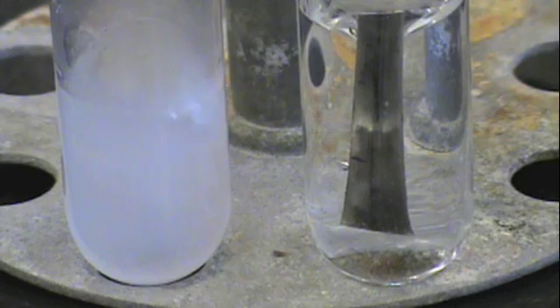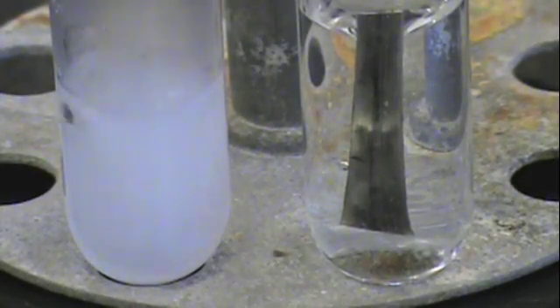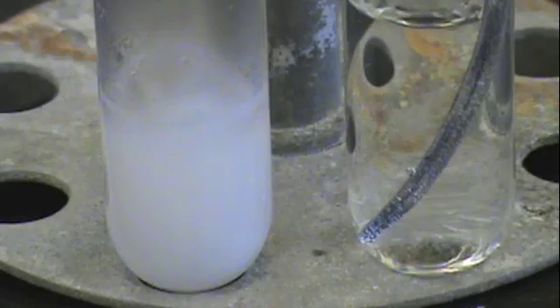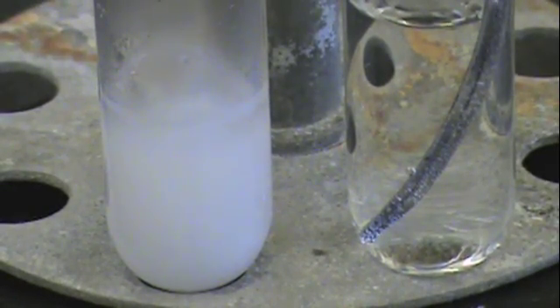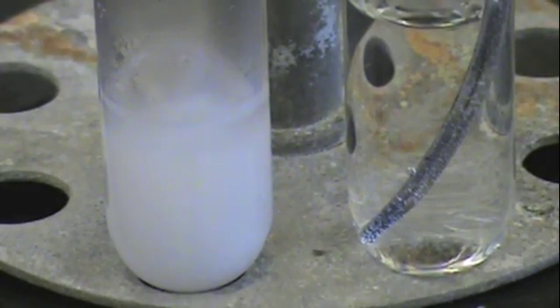The reaction of magnesium with water is much slower. So calcium continues to bubble vigorously, leaving you with a white solution when it has completely reacted with the water. And if we look at magnesium, we see that small bubbles are starting to form on the surface of the metal, meaning that it does react with water.